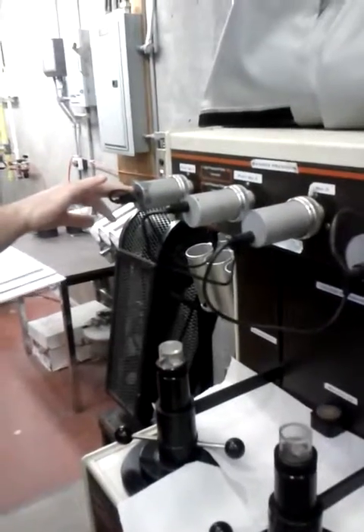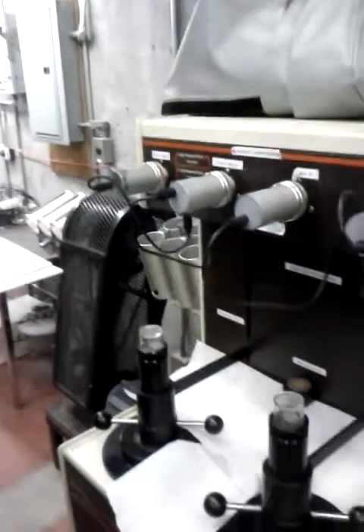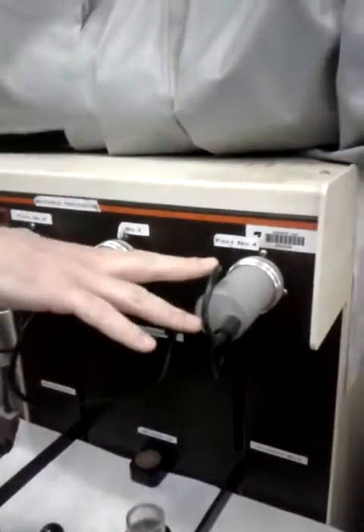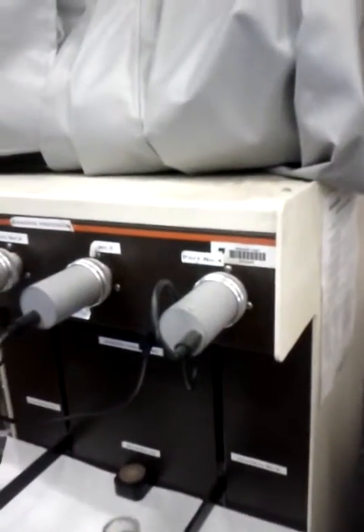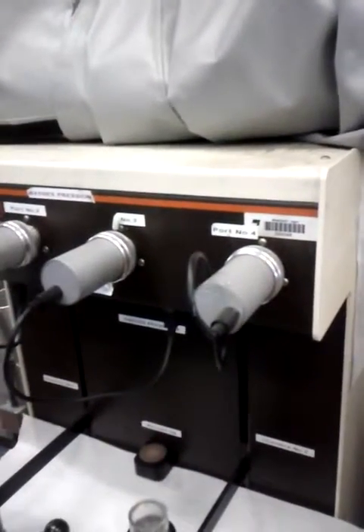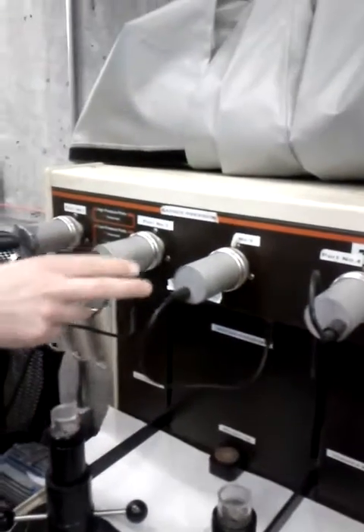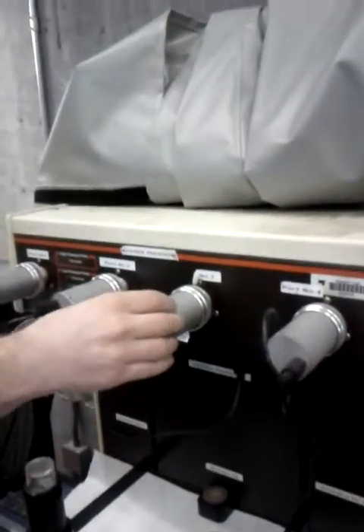So now we will proceed to the low pressure test. We got 4 places to perform the test, but the first one is broken, and we only have 2 penetrometers. And for the high pressure, we only have 2. If we have 4, we can make 4 and after 2 and 2, but because we have only 2 penetrometers that have the same geometry, it's easier to make only 2.